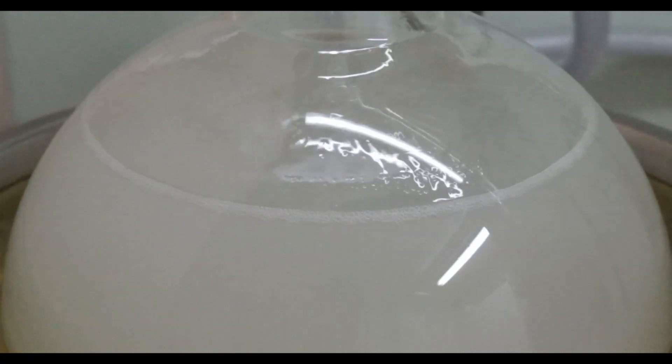The distillation is slow and it took me eight and a half hours to collect 330 grams of crude isopropyl chloride. At this point the rate of distillation crawled almost to a stop and I decided that it was no longer worth waiting for the final couple milliliters of product. I disassembled the apparatus and continued the next day.